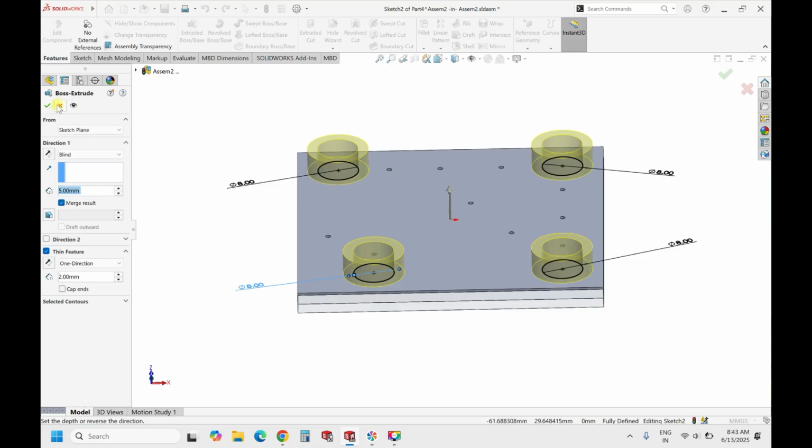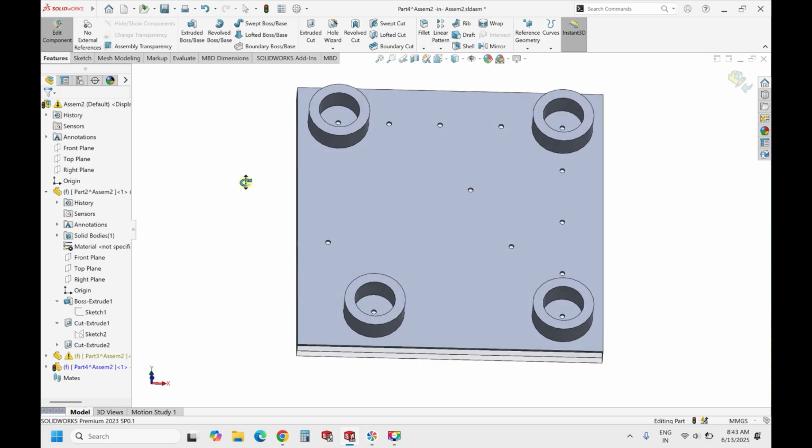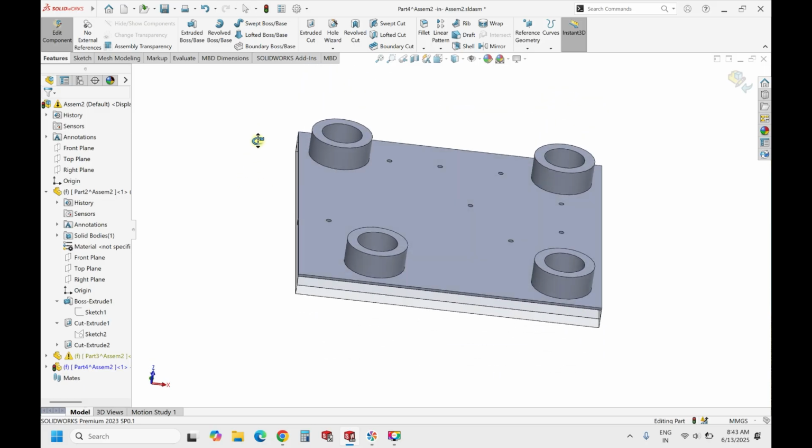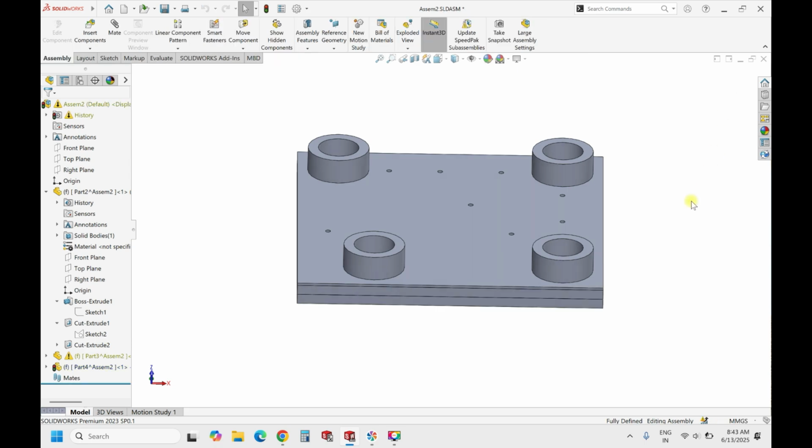So this is not needed; this can be needed for the PDMS based approach, but instead you can use the walls directly. And to make it look more aesthetically good, just use the fillet option which is over here. You can just fillet the edges, just to make it look more proper. So once you extrude, you'll see this design is complete.